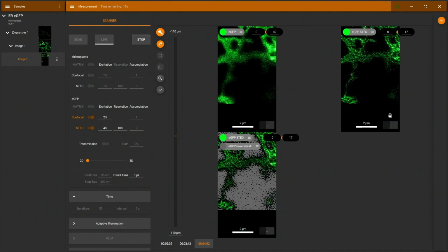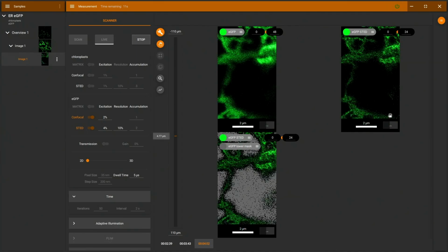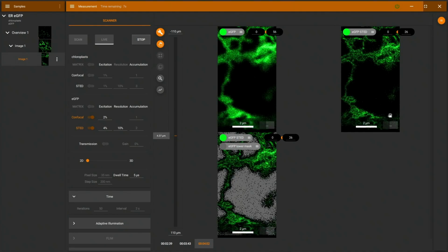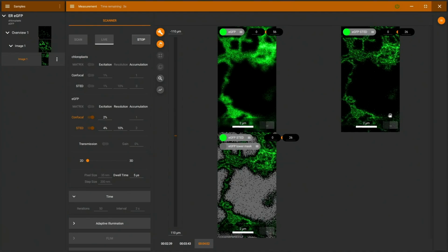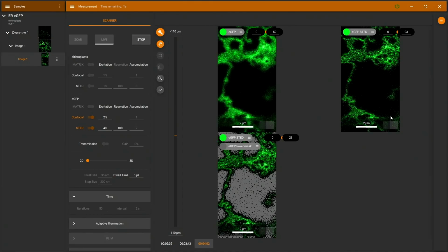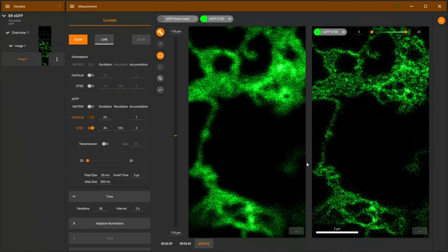I think here in the center of the image, we can also see that this part of the cell is slightly 3-dimensional. So on the sides, we have more structures in focus. And if I change the focus a little bit, we can see the center a little bit brighter again. But here we were recording 50 frames easily without any bleaching. And it was a very nice movie.